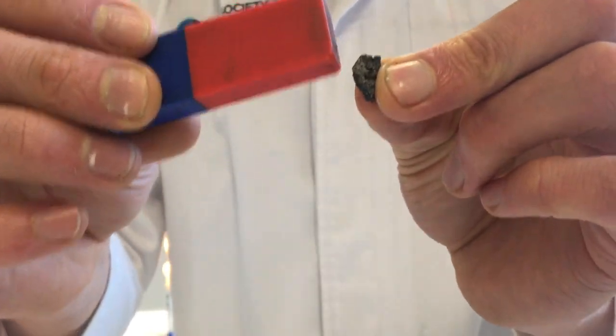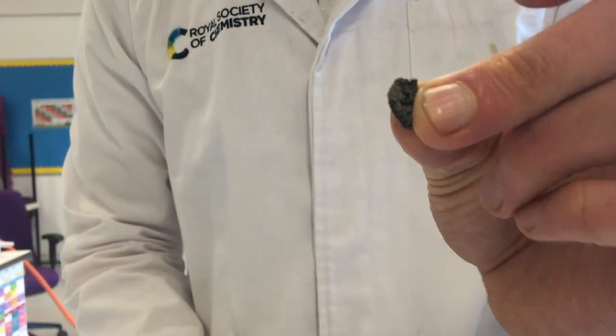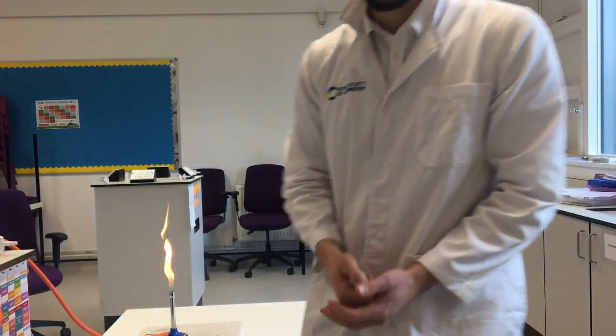When I did it to the mixture of iron and sulfur, I could pull them apart, but because it's a compound, I can't anymore. I think that's a very good experiment for explaining two elements, iron and sulfur, a mixture of the iron and sulfur, and iron sulfide, which is a compound made of the two. I hope that made sense.